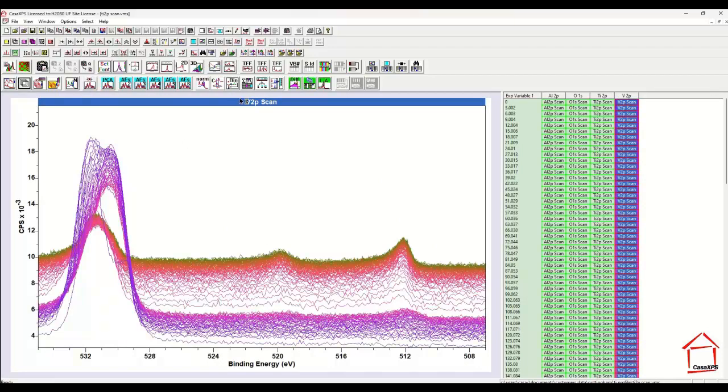So to allow us to focus on just the vanadium and calculate the signal for these relatively noisy vanadium peaks, what I'm going to use is this toolbar button that creates spectra from regions. And what this means is that I will be able to define a region for the vanadium 2p, and I can also define a region for the oxygen 1s, and then I can use this button to create a new VAMAS file that contains 2 VAMAS blocks where there was previously 1.